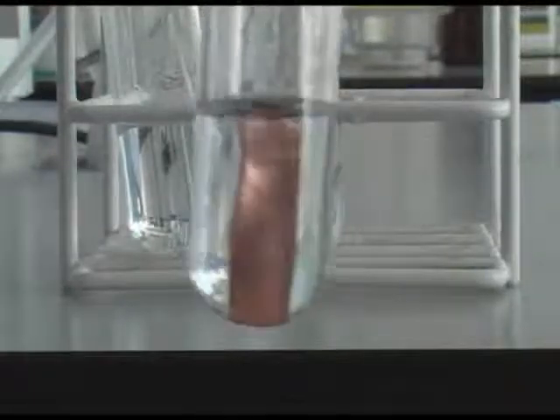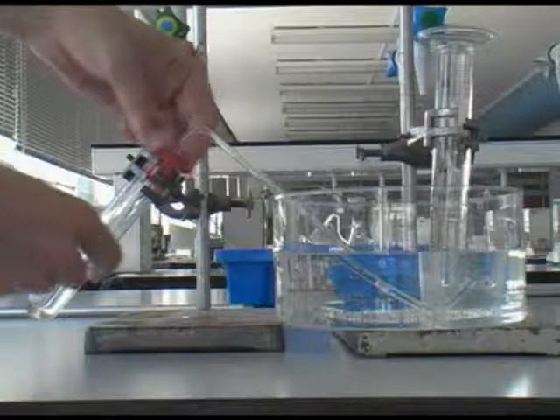In the case of copper, there's no evidence of any gas being formed. It doesn't react with sulphuric acid. In the next part of the video, we're going to look at the reaction between magnesium and sulphuric acid again. This time we're going to consider how the volume of gas produced changes over a period of time.